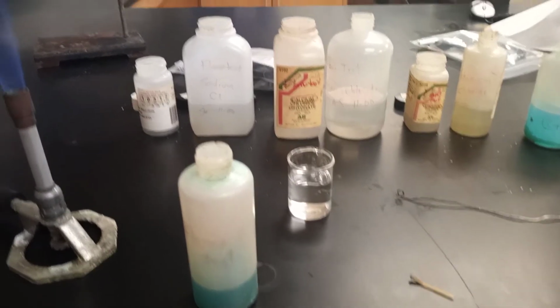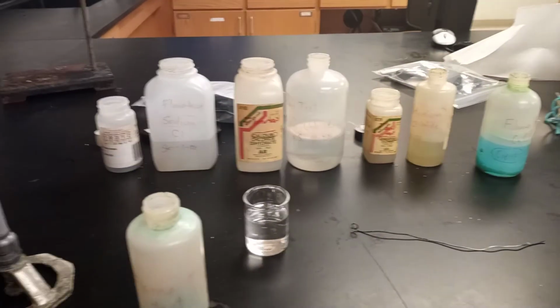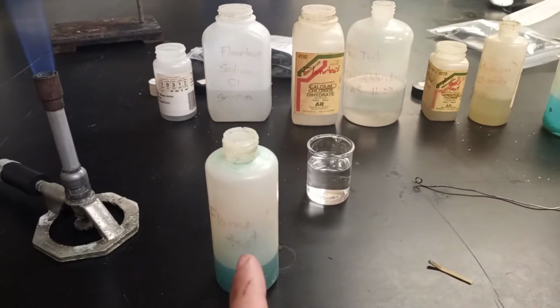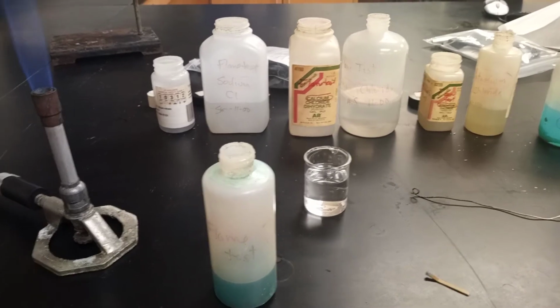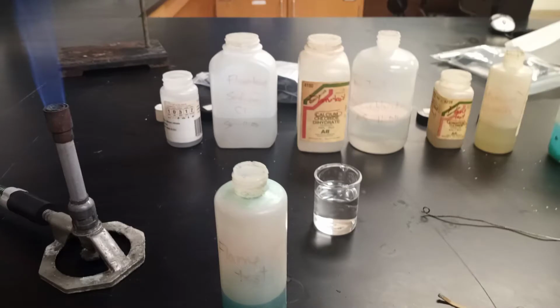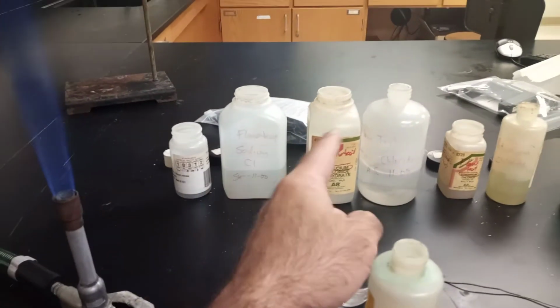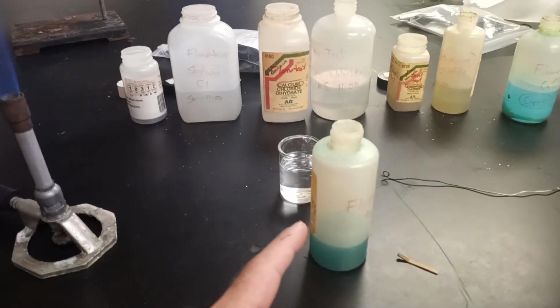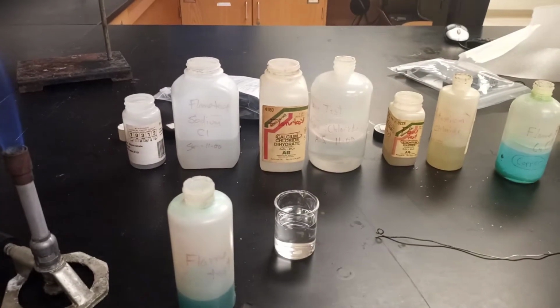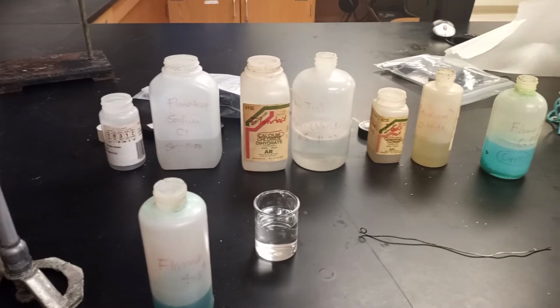But this is what's going to happen. We're going to burn each chemical in the back there, and then we're just going to simply compare it to the colors that occur when we burn this one. And whatever colors you see in this one, you can then identify because of the colors you saw in the previous ones that are over here. So if you see a color here, then you see a color here, chances are it's the same chemical. Now again, the analysis of this is very simple, but you can't just in your conclusion mention that, oh, the colors are the same, so that must be there.